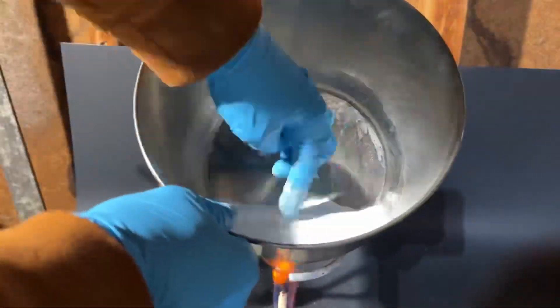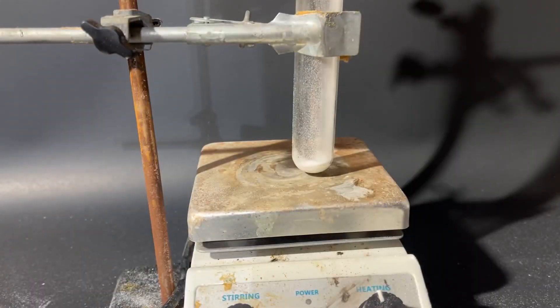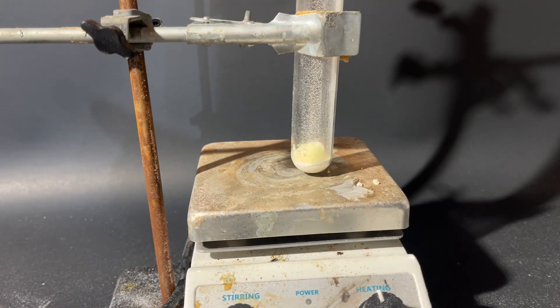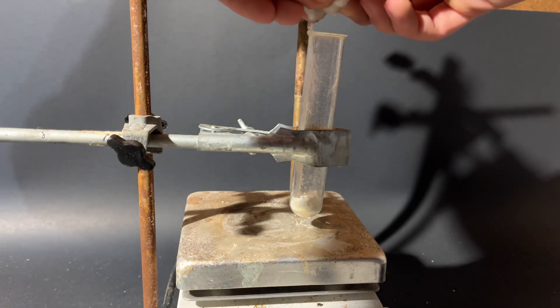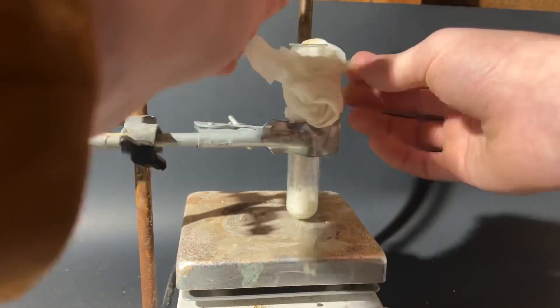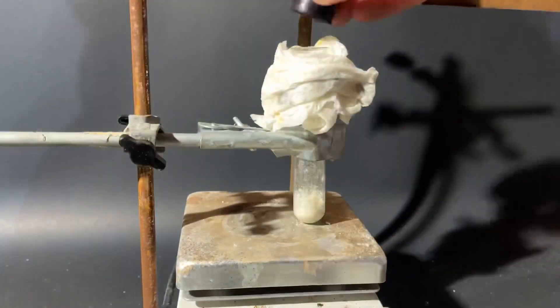After I do this, I have sodium carbonate. And to carry on, I add about a gram of sodium carbonate to an equal amount of ammonium chloride, along with a smidgen of water, to a test tube that's slightly closed by resting a stopper on top, and cooled with wet paper towels.